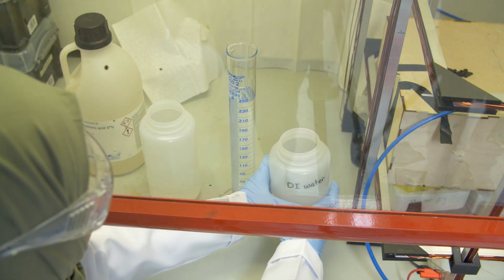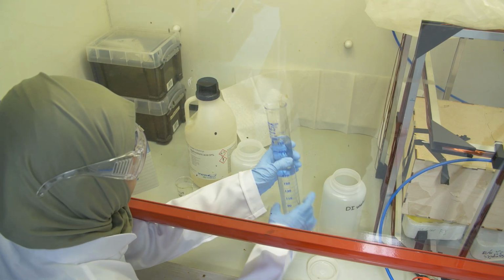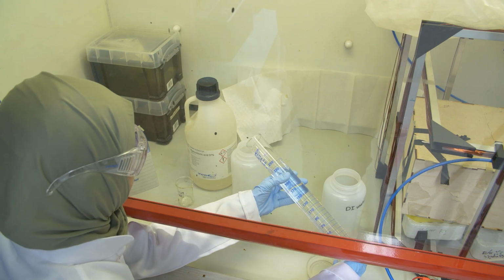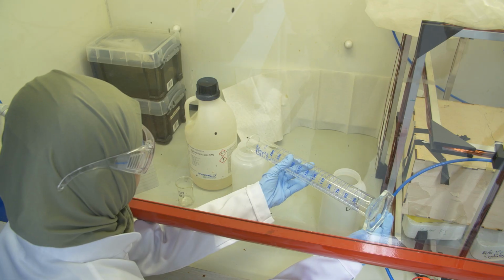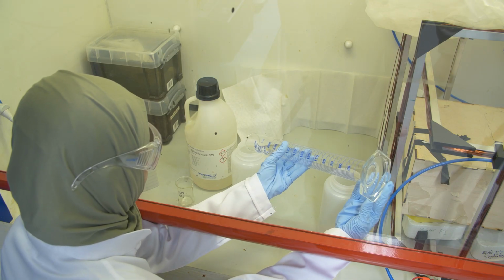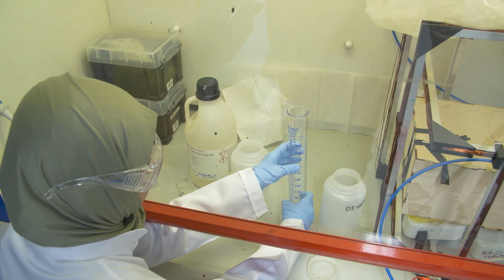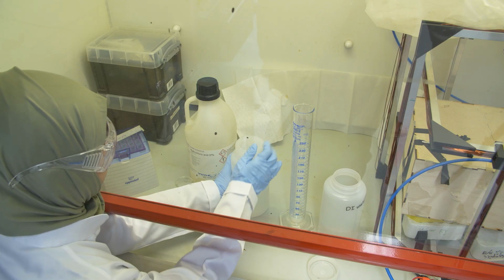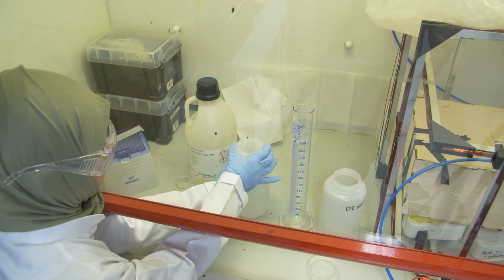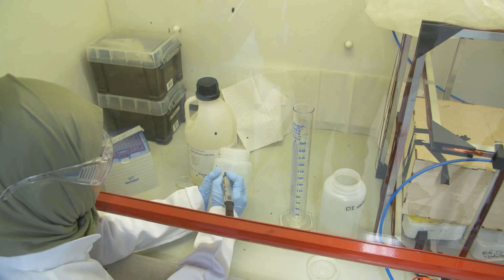Make very sure that the water is at 250. Okay, so the meniscus, and look at the meniscus. Okay, so she adds now the water, and then afterwards she will add the acid. Always test before you do any experiment so that your movements work fine, so that you don't feel restricted. Once you then work with the acids, you want to make sure that you have good movements.